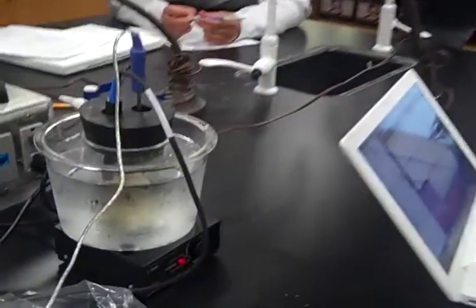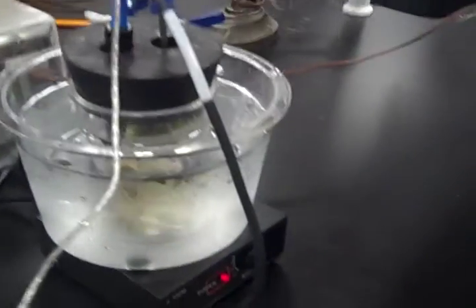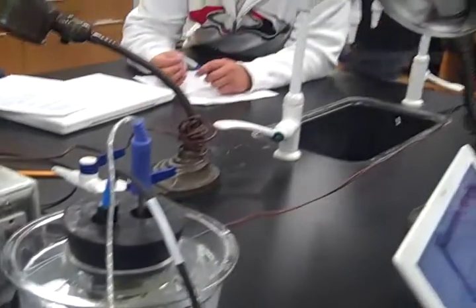In conclusion, we think that the photosynthesis didn't work as well because there was cold water in the tube, which was produced by the ice cubes. So my prediction for this lab is that once we put the plant into the water, the oxygen level will rise because the plant will be carrying out photosynthesis. I think that the light will accelerate the production of oxygen, so the oxygen level will go up higher.